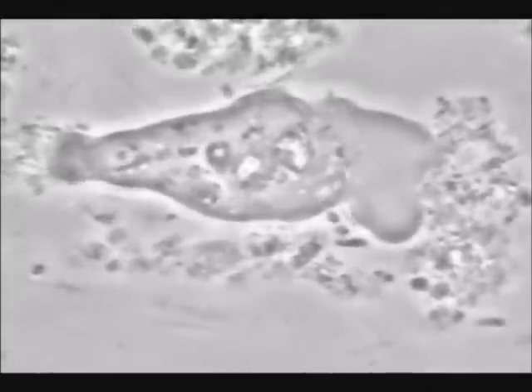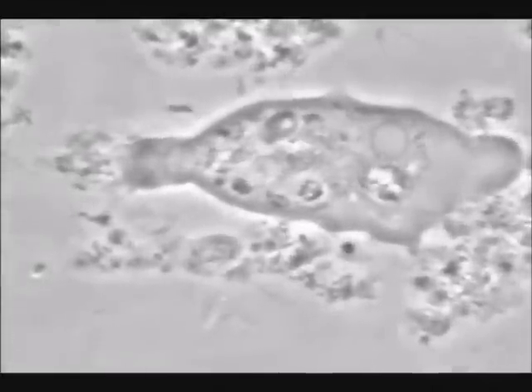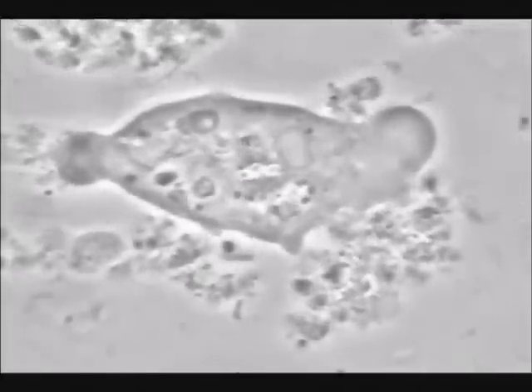Entamoeba gingivalis with the capping phenomenon in aggressive disease — the redistribution and capping of the surface receptors on the periodontal pathogen can be observed. Capping is correlated with plasma membrane folding towards the rear of the amoeba.